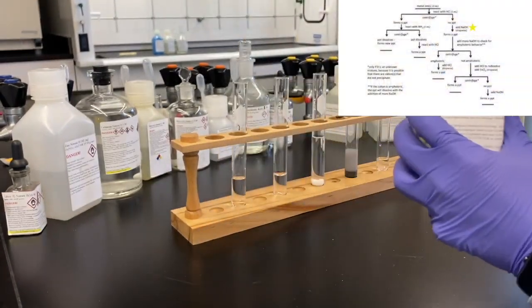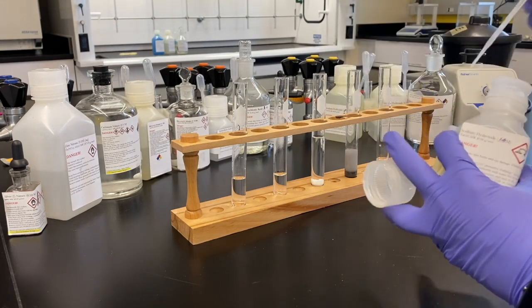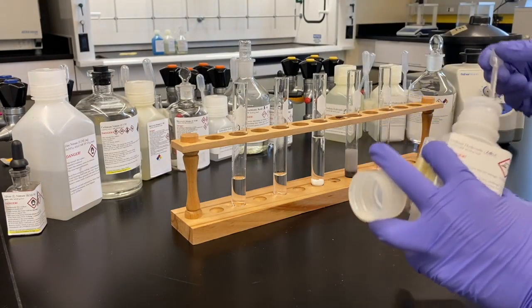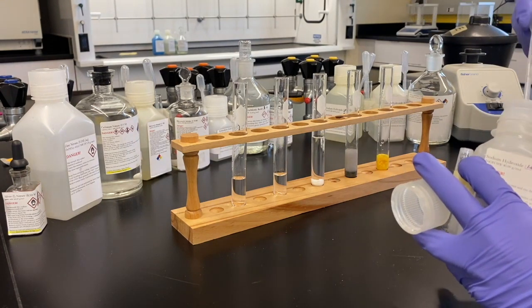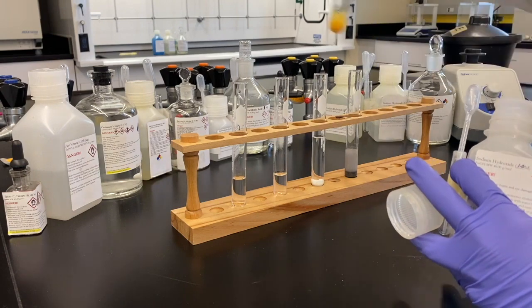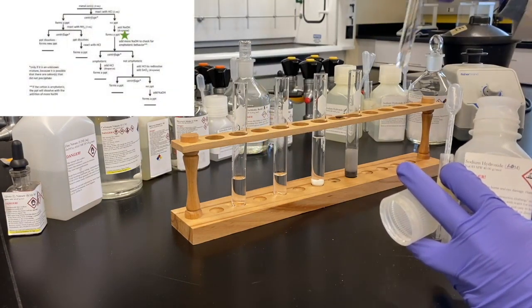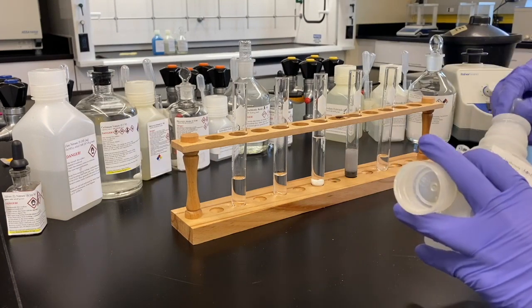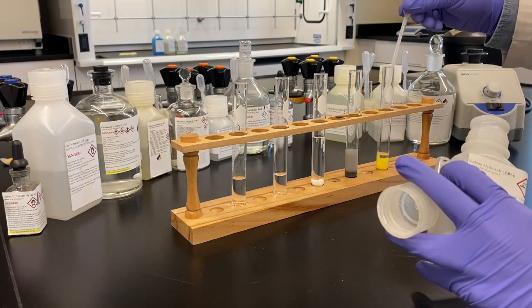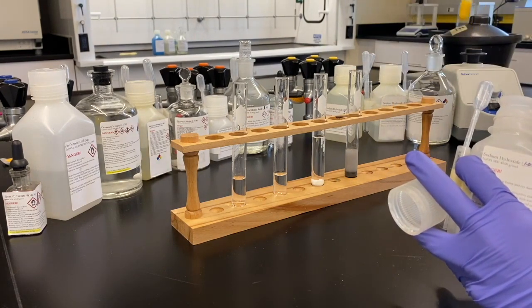So we're moving down the right side of the reaction tree and adding sodium hydroxide. It's a nice color. Ooh, lovely. Some mercury 2 hydroxide. And it disappeared, so we'll see if adding a little more makes it come back and stay. It might just not have been enough base to keep it around in solution.